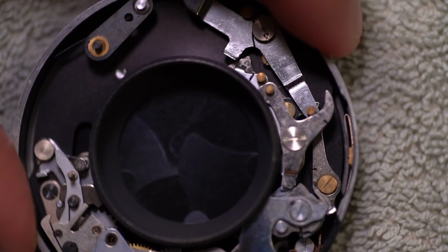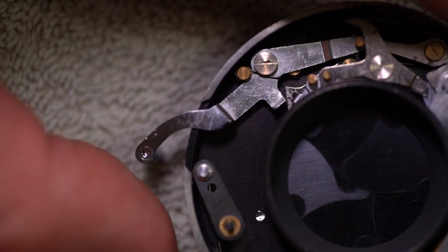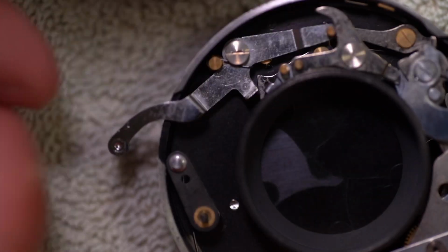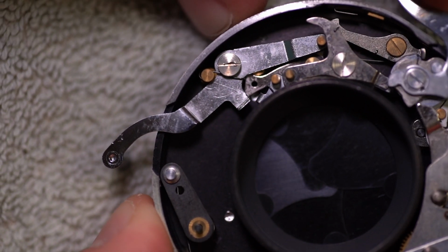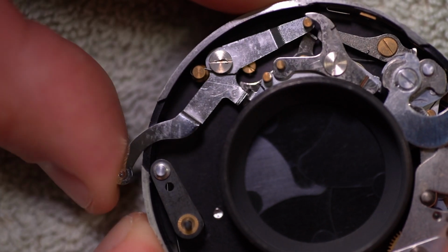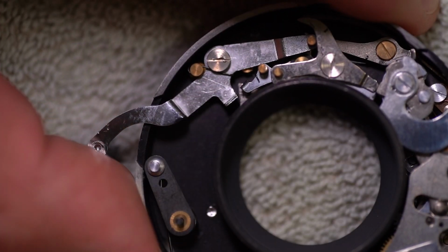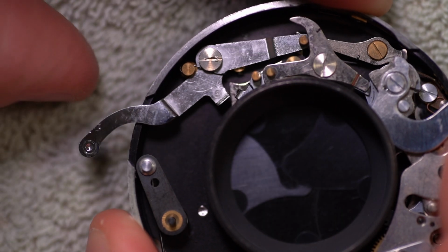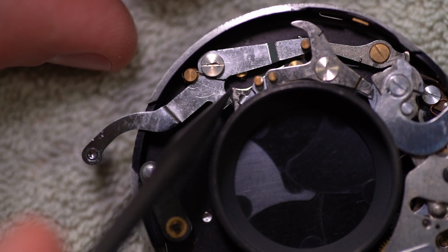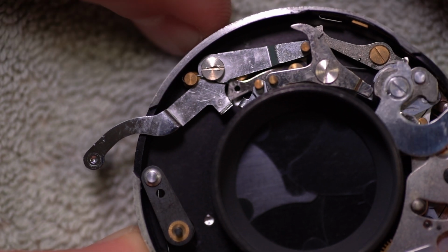I'm going to turn that around and see if you can see that a little bit better, maybe. I don't know. I can't really see this that well. But basically this little piece, I think it pops out a little bit better. Yeah, there you go. That piece right here that just moved, you can see it doesn't really work until I push it in and it actuates that. And then if I push it in again, it sets that. Now, again, I'm going to do it one more time. Watch this little arrow-shaped thing here. Pops out.